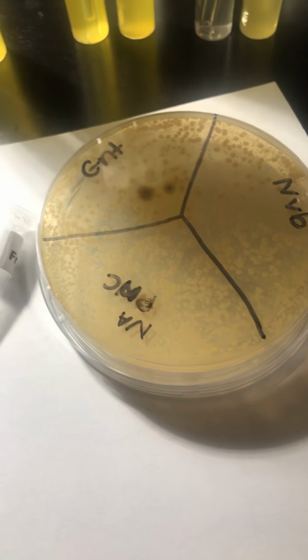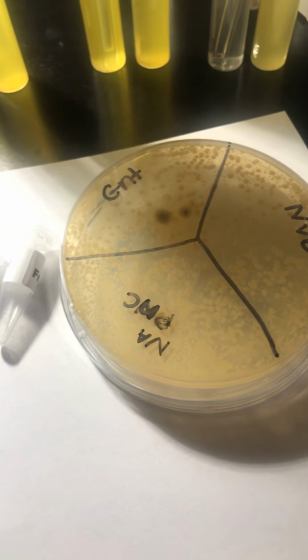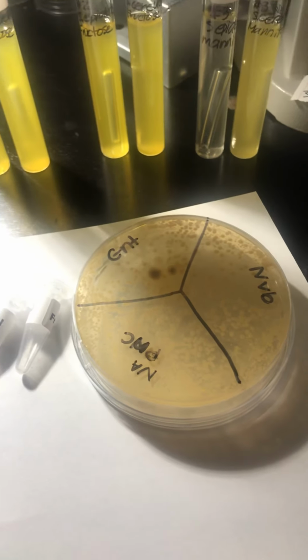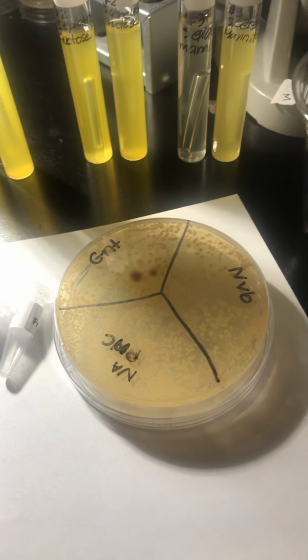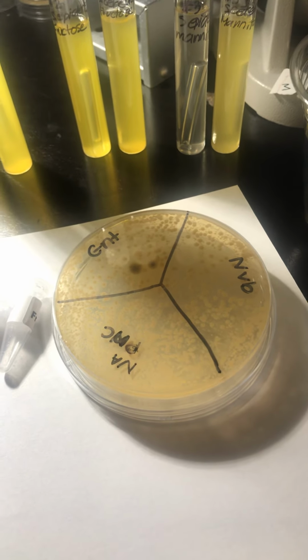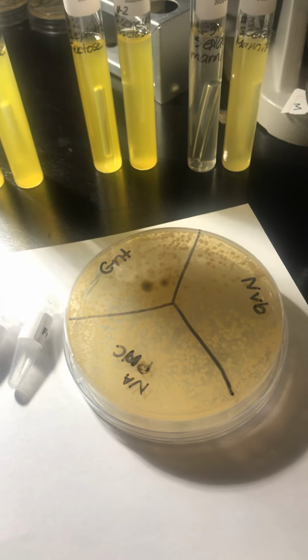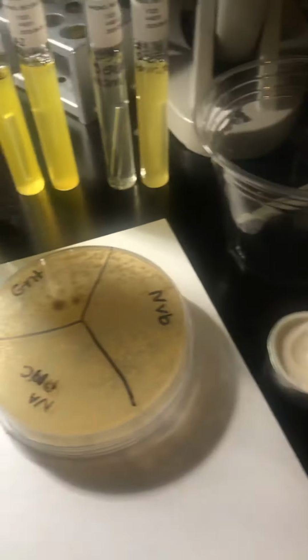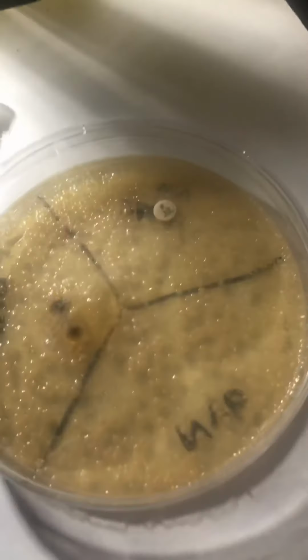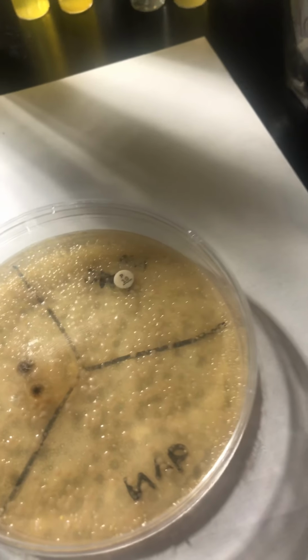And then I'm going to have the agar with the lid side up approximately 1 to 2 hours until the broth is absorbed by the agar. And then once the broth has been absorbed into the agar, I'm going to remove the plastic tweezers from the alcohol, shake it, and dry it. And then using the tweezers, I remove the penicillin disc from its plastic bag, and I would place it on, if you see it, right there.